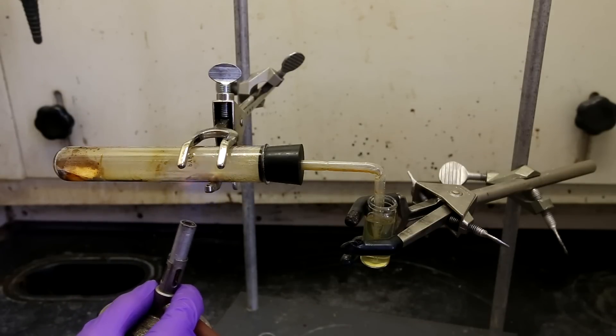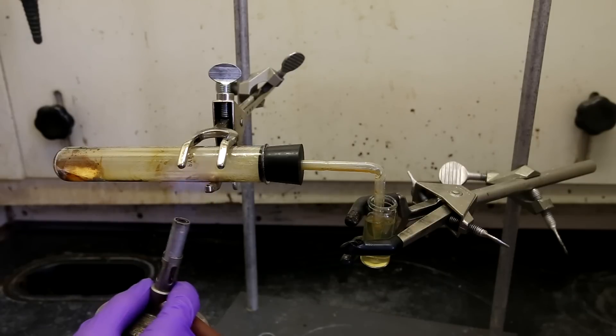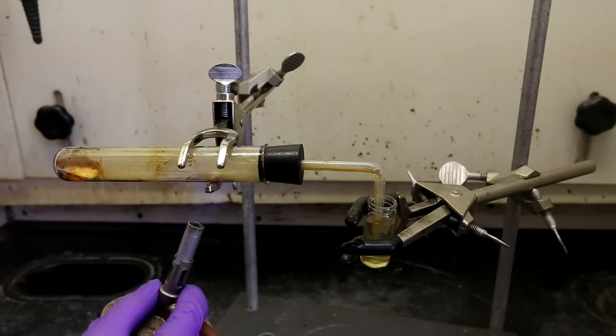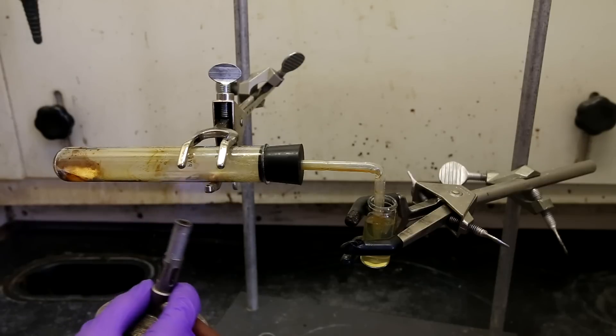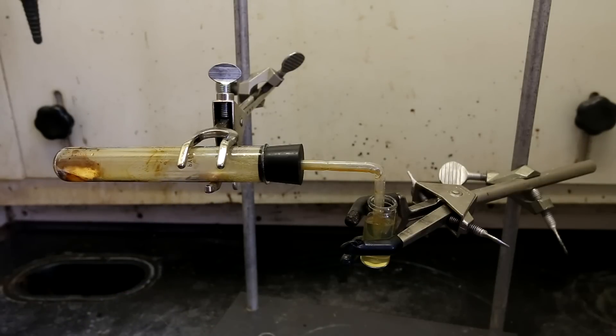In theory, you can include no water in the dram vial and simply just collect the distilled over cadaverine. However, I opted to use water because I wanted to limit the amount of cadaverine vapor that entered into the lab air.